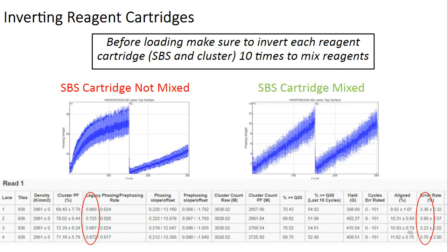Now, another major consideration is the appropriate thawing and inverting of our reagent cartridges to make sure that they are thoroughly mixed. So before loading, once we've thawed our reagents, we want to mix them by inverting them at least 10 times. Okay? And this is a really crucial step because it ensures that we have a homogeneous reagent mix that is going on to the instrument. And if we don't do this, what can oftentimes happen is we'll see impacts to clusters passing filter, increased PhiX error rates, as well as increased phasing, all in read 1, with typically some recovery in read 2. And we could see very clearly the difference between a SBS cartridge that was not mixed before it was loaded onto the instrument and a SBS cartridge that is mixed as expected.